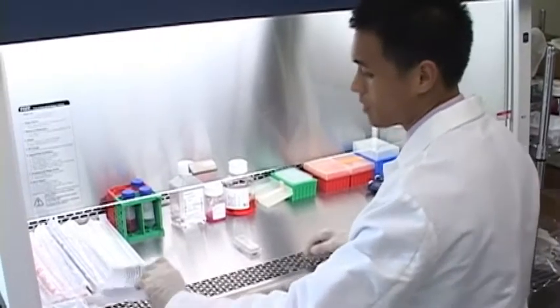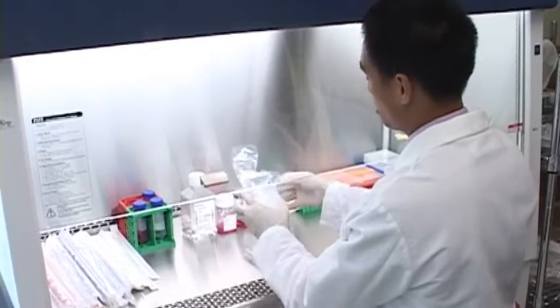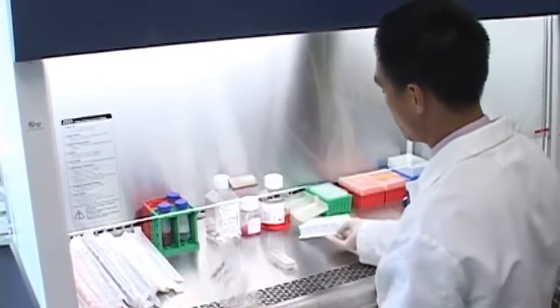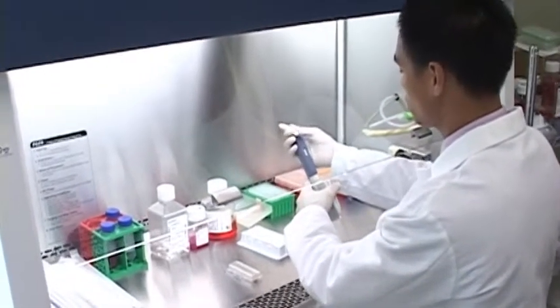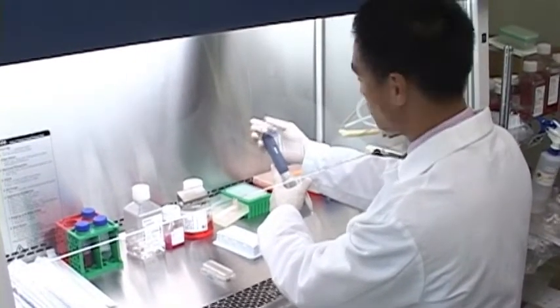And so as I mentioned, the first step will be to acquire the background measurement. So in that case, we'll be adding 180 microliters of media to the bottom of the well. Now in general, we recommend going no lower or no less than 150 microliters for your background measurement. This is just to ensure that there is enough media in the wells to coat the entire bottom of the substrate.